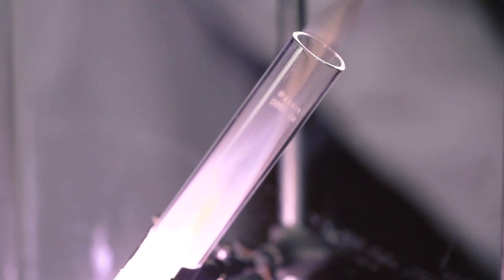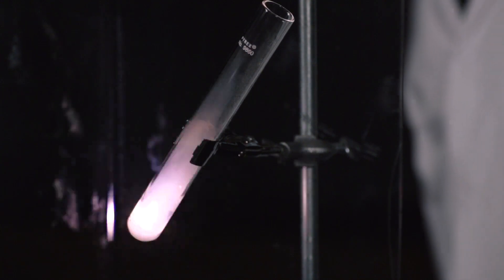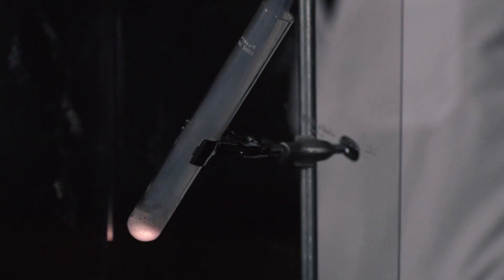What then do you think will happen when we heat five grams of it to its melting point around 700 degrees Fahrenheit, and then drop in a piece of chocolate-covered candy? Wait, what? Okay, random, I know. So let's take a step back, literally. Let's talk about candy for a second. As you can see, the color on the candy shell burns off almost immediately.